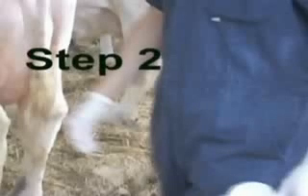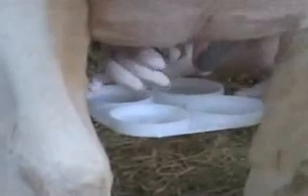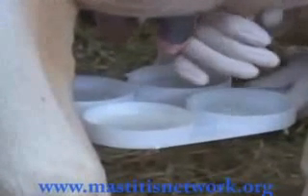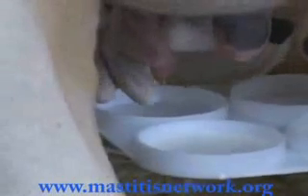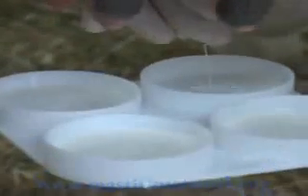In step 2, always use the same paddle position from cow to cow, always on the same side of the animal, right or left. This will make it much easier to keep track of quarters when interpreting results. Collect milk from each quarter into the respective paddle cup, covering the bottom of each cup.